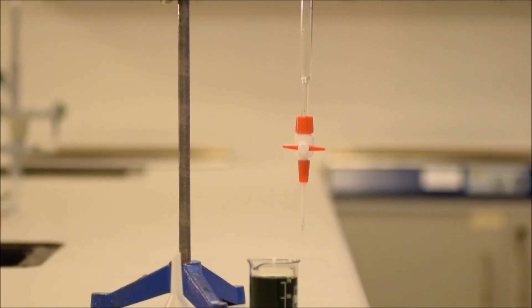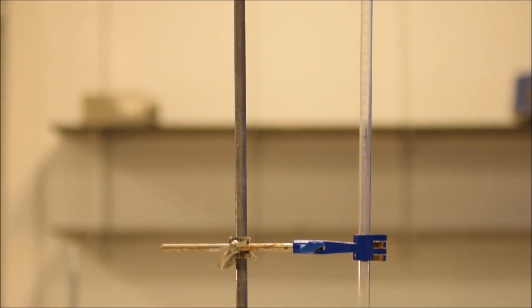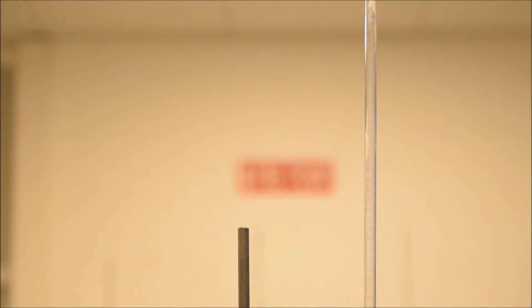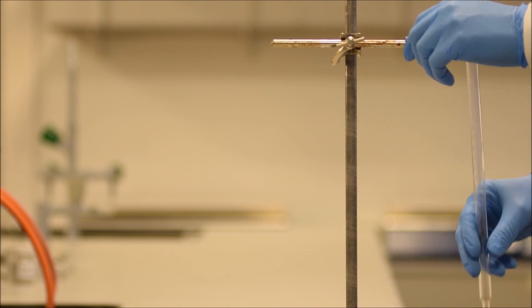And so you'll see it's clamped here, so that it's suspended over the bench, and we can use it to fill it up with liquid. The first thing that we want to do is put our liquid into it. So, assuming that it's clean and that we've rinsed it out, we need to be able to pour our liquid in.